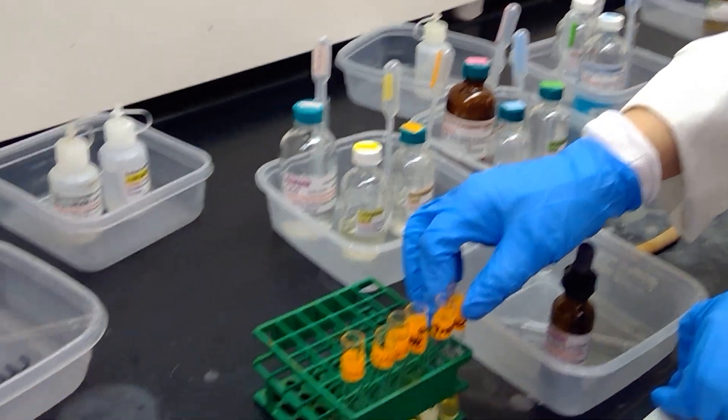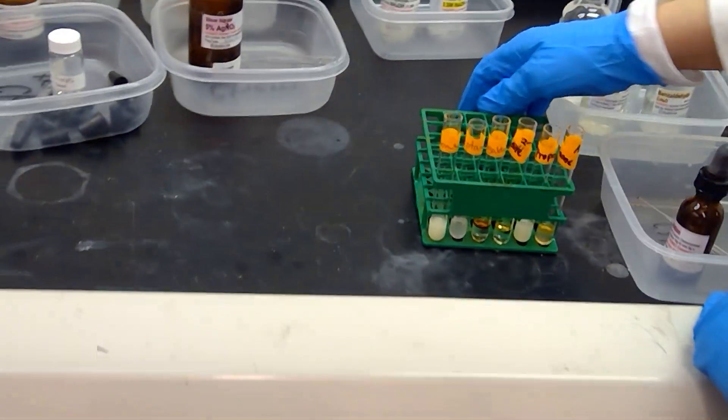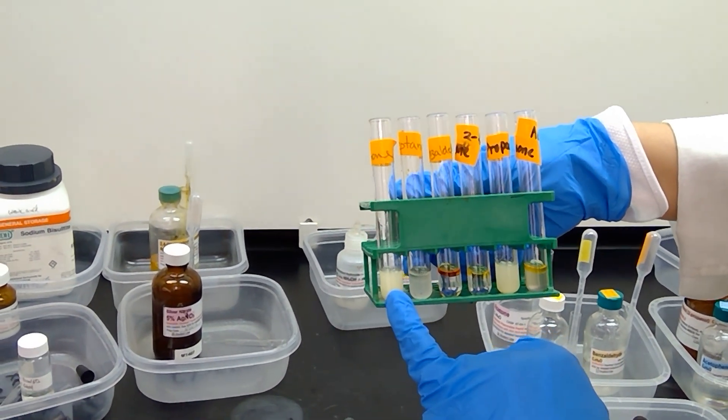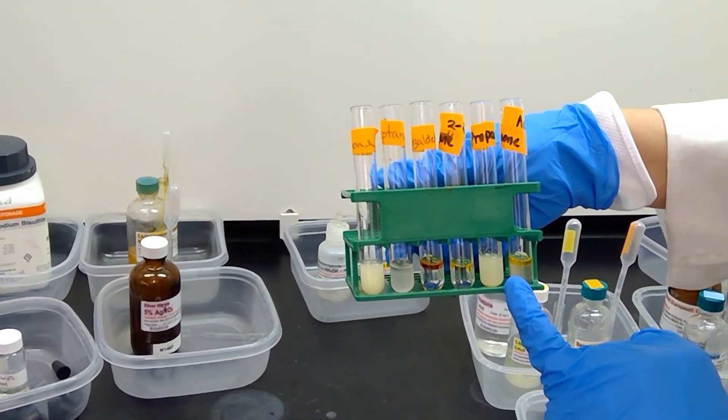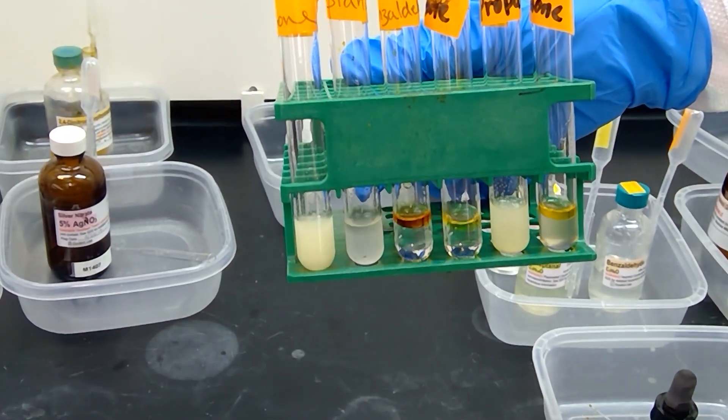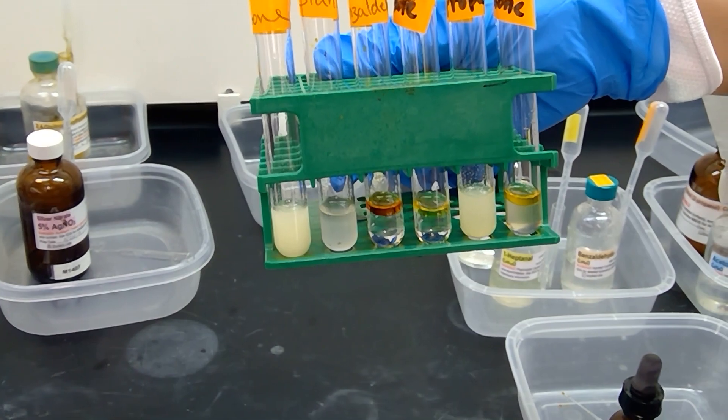Just to reiterate, our two positive samples for the iodoform test are for sure acetone and 2-propanol. All the other samples did not produce precipitate. This has been the iodoform test for experiment 20.